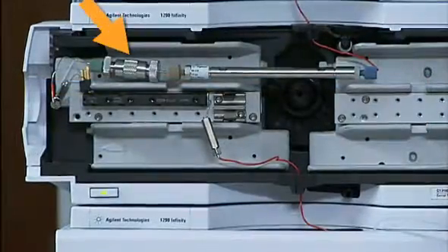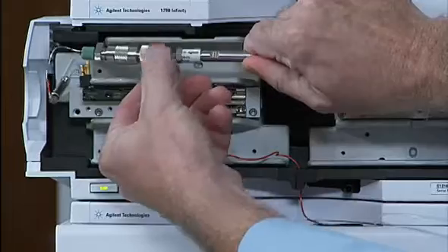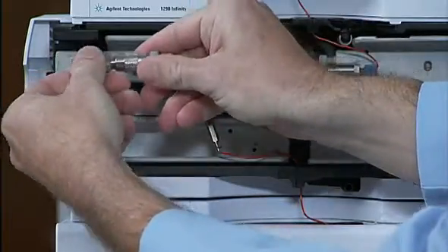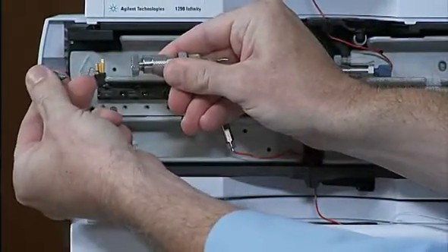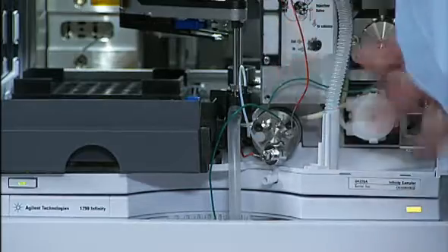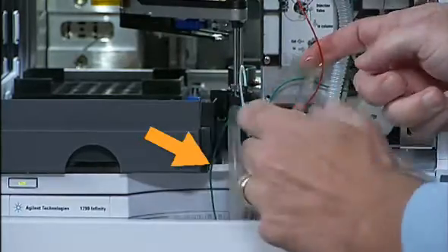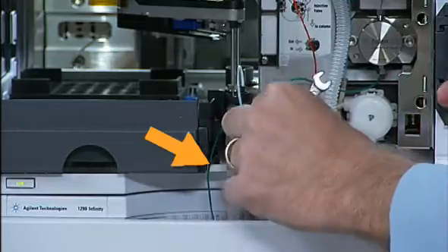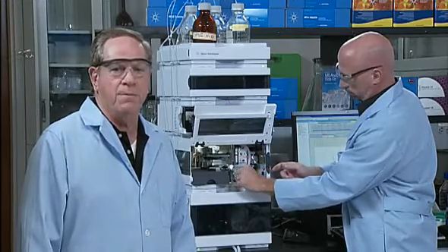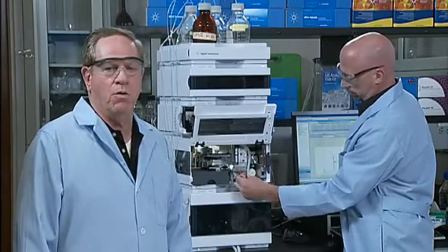If a guard column or an inline filter is present, we should also disconnect them one at a time to see if the blockage is occurring in one of these components. If the system pressure stays high when the column or guard column or inline filter is removed, then we must work our way upstream of the column to figure out where the restriction is located. So the next possible upstream blockage could occur in the piece of capillary tubing connecting the injector to the column. By disconnecting this capillary, we can quickly find out if the blockage occurred there. Still, if the pressure remains high once we remove that fitting, we must continue to work further upstream, removing one component at a time until the clog is found. Once located, the culprit must be replaced in order to solve the back pressure problem.